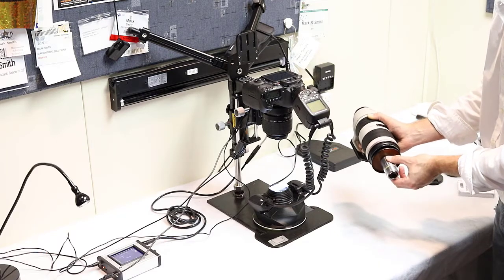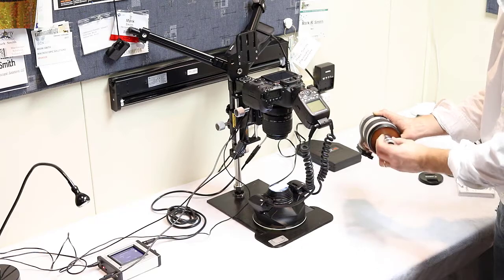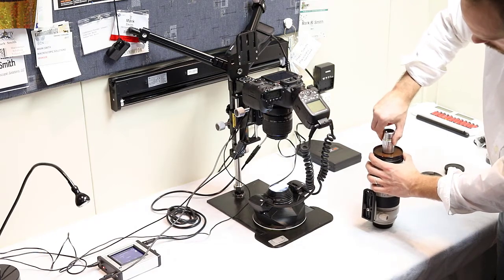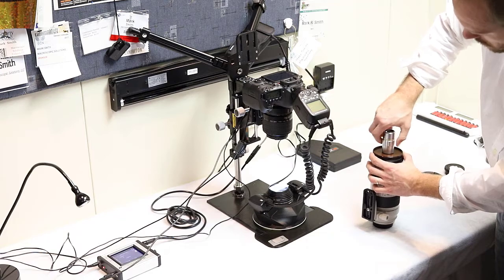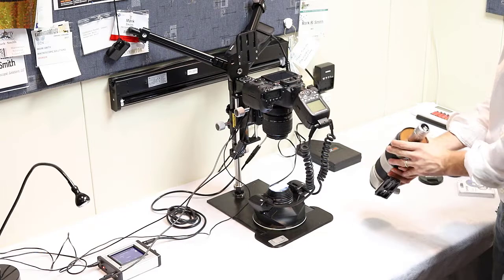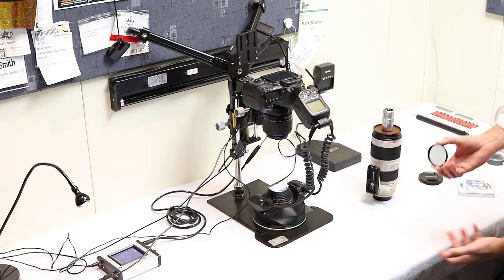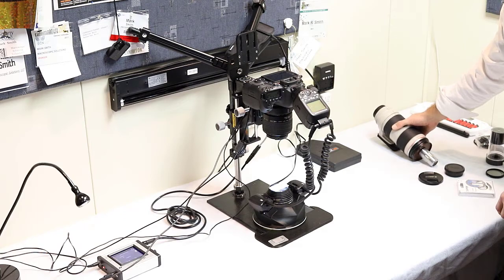That's mounted, and then you'll just add your adapter directly to the front of that adapter. We'll just set that down so I can hold it. The polarizer allows you to spin, so you want to make sure that it's actually threading into the polarizer. There you go. And that is how you would add the polarizer. Now, if you don't want to do that every time, the other thing you can do is just take your polarizer and set it right over top of your thin section. That's another option.